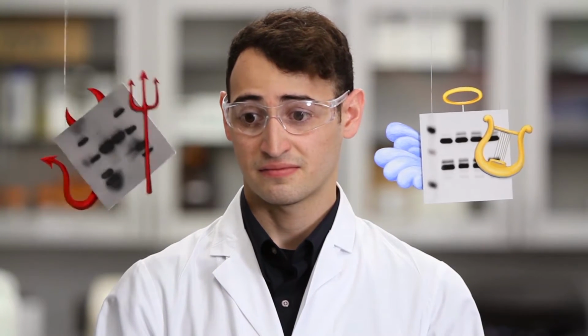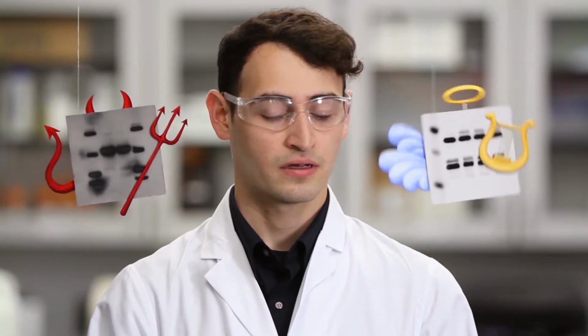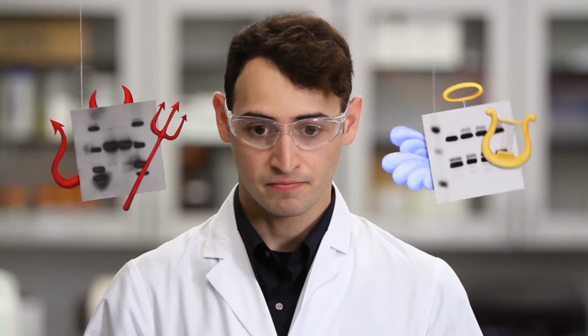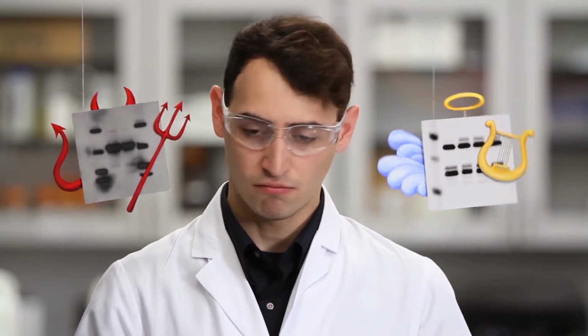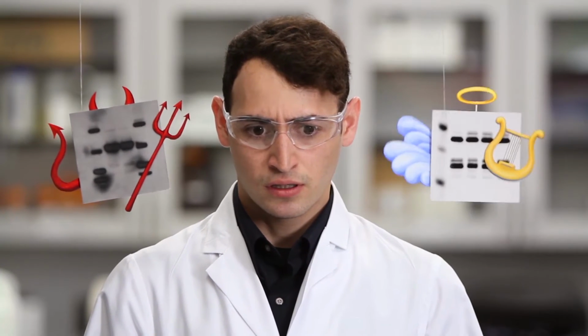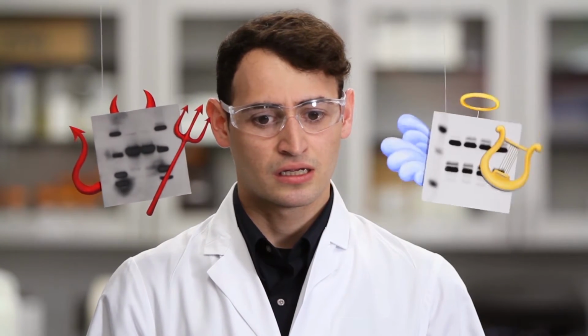You want more work just because Blockhead Buffer says so? Stop name-calling, you messy membrane. Okay, then. GAPDH it is. Wait, why GAPDH? That's what everybody uses. We've never had any problems before. Maybe we should make sure whatever we use has stable expression for our cell types and treatments.